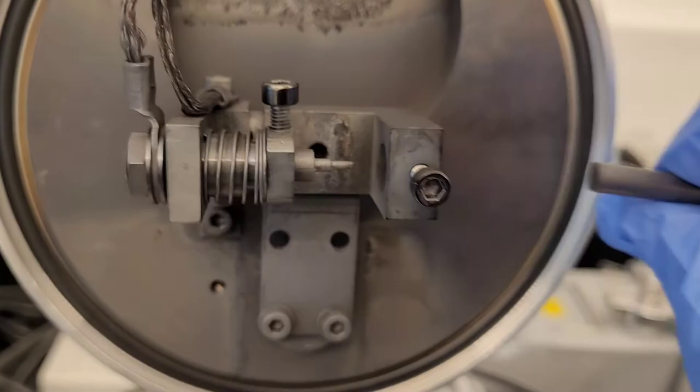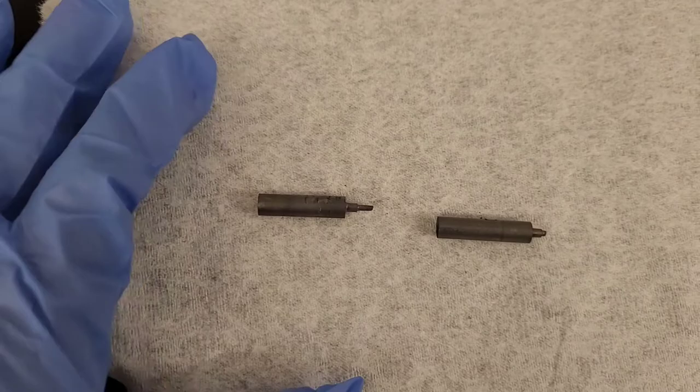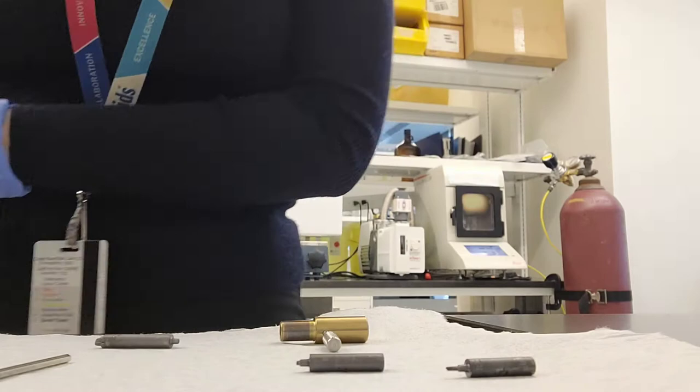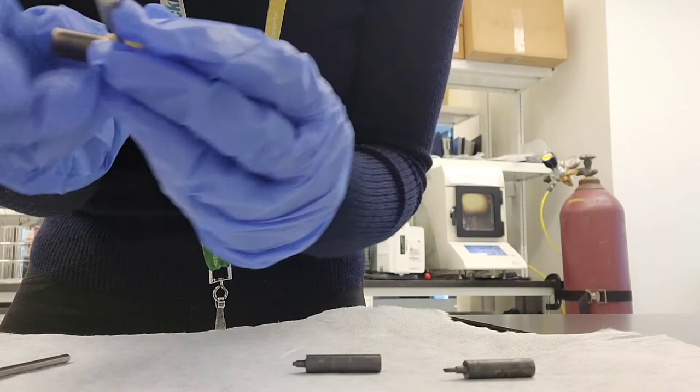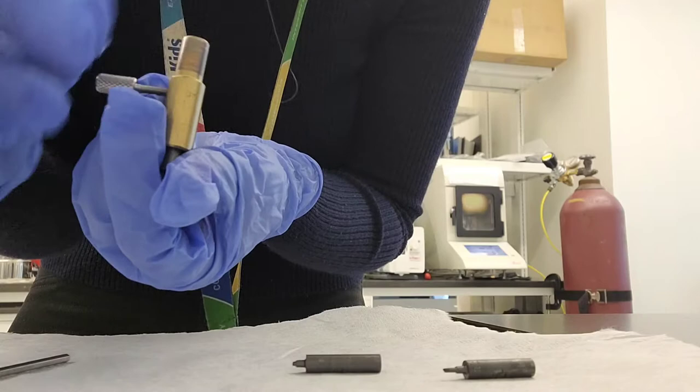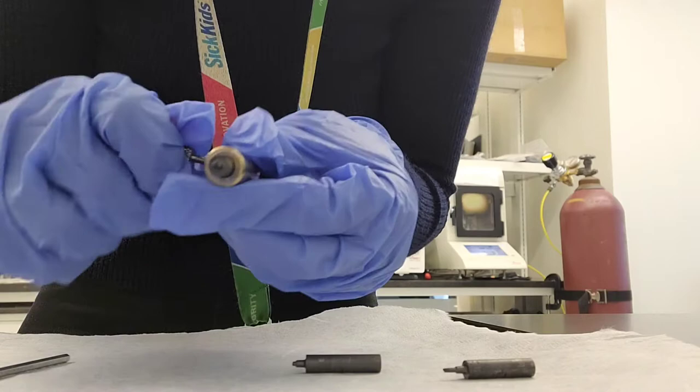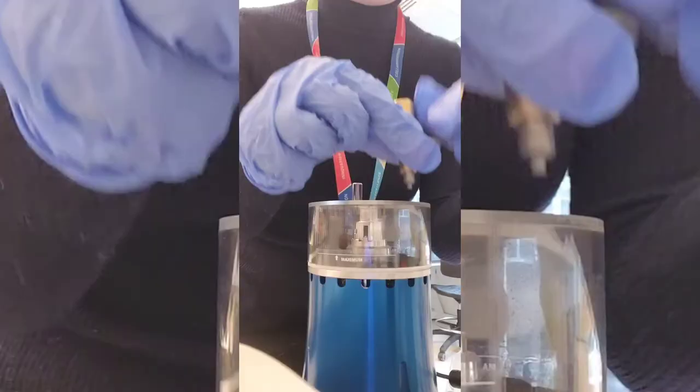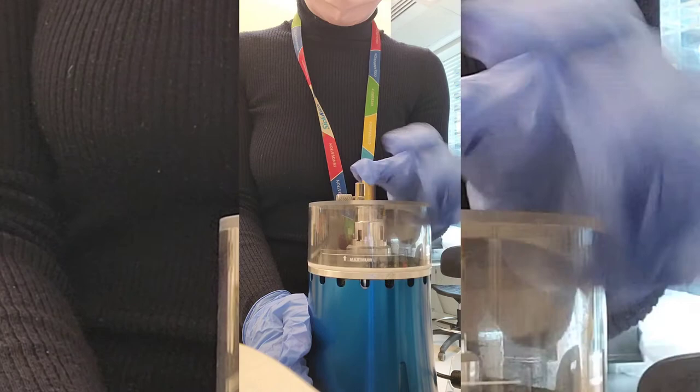I'm unscrewing the pins and taking these out. There is a flat side and a side that has the rod-like thin rod. You want to take the side that has the thin rod and put it in this kind of tool. You have to make sure the thin side of this instrument is where the other thin side of the rod is. The thin part is where it will fit into this sharpener. This is the correct way—you will just insert the thin side in with the part that you want to sharpen.